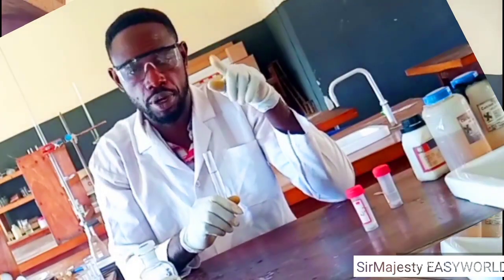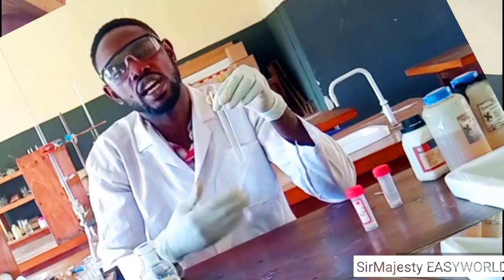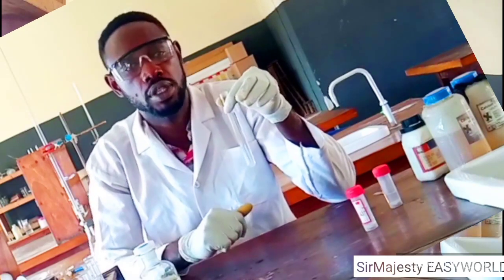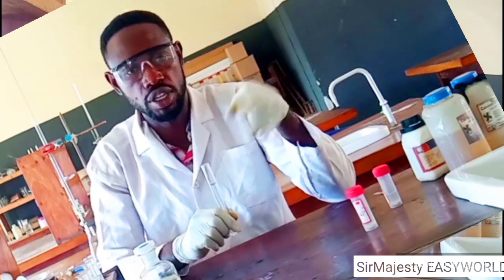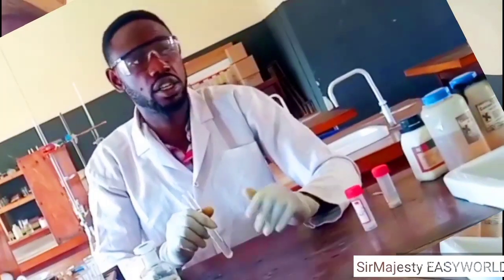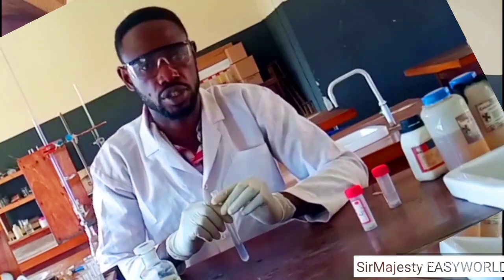But I told you one thing, I'm repeating. In real sense, because it's chalky, and I'm experienced in this, there is no need of even calling aluminium or zinc. Zinc is very much gelatinous. But let's assume we didn't take note of the nature of the precipitate. The exam bodies should not include zinc or aluminium when you report a chalky precipitate. But when I go through some marking schemes like that of WAEC, they still give marks to those that included zinc or aluminium, even though it is chalky. That's not science, but with time we will come to perfection.